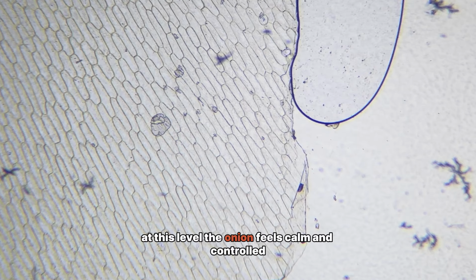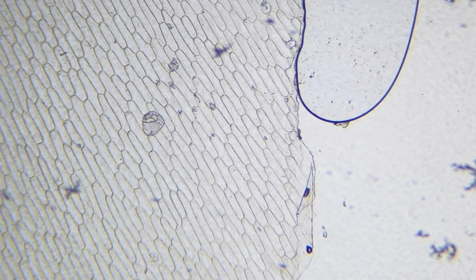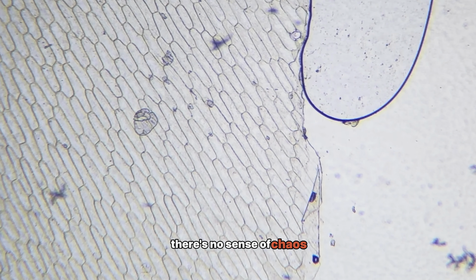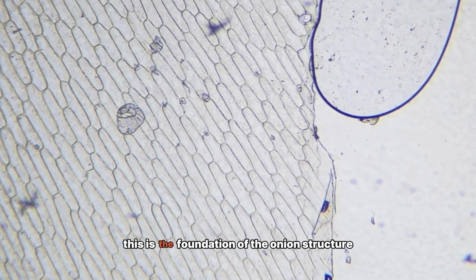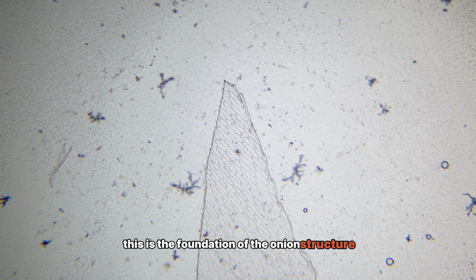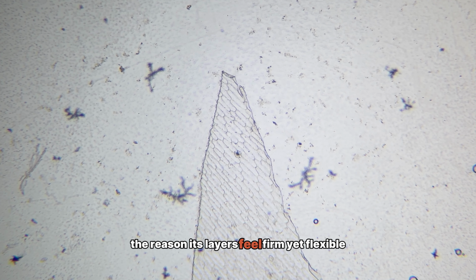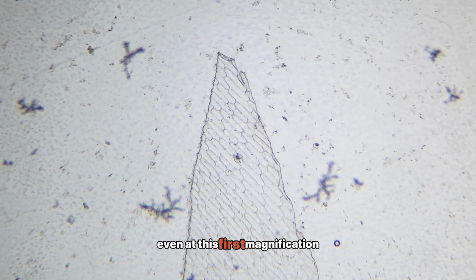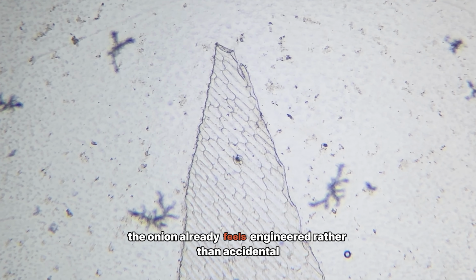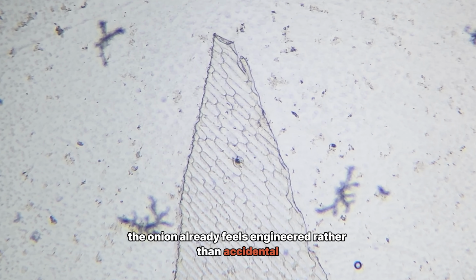At this level, the onion feels calm and controlled. There's no sense of chaos, only repetition, order, and balance. This is the foundation of the onion's structure. The reason its layers feel firm, yet flexible. Even at this first magnification, the onion already feels engineered rather than accidental.